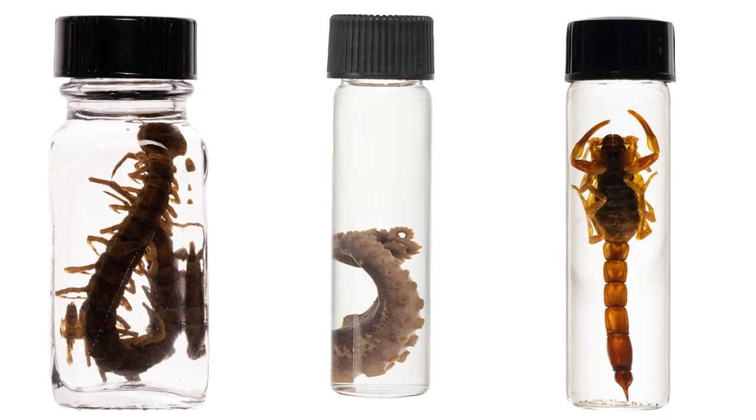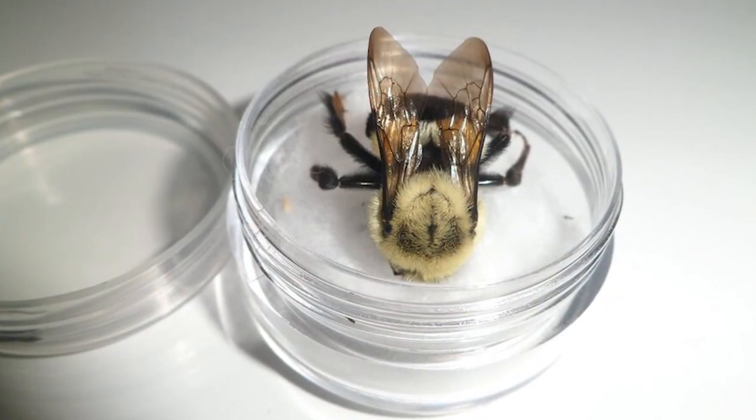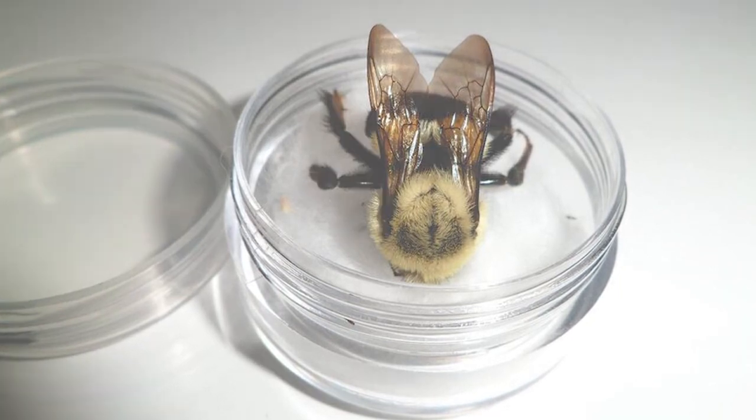For dry and wet specimens, different methods are used when setting them under the microscope. If the specimen is in liquid preservation, there is a shine issue — we must properly remove the glycerin by wiping with tissue before study, because glycerin causes shine that interferes with observing the characteristics.